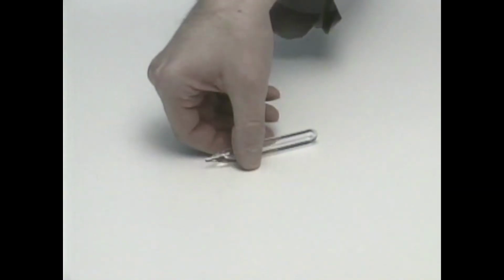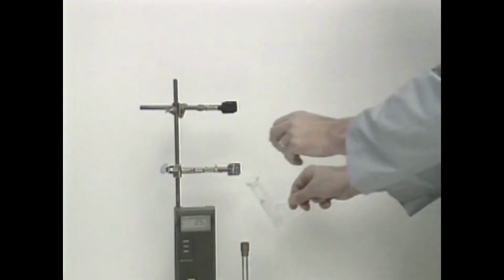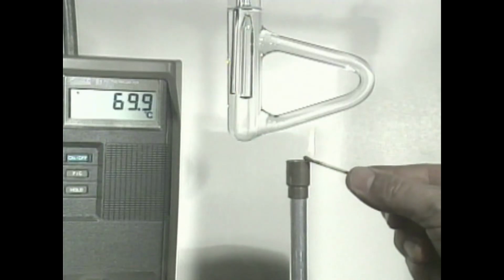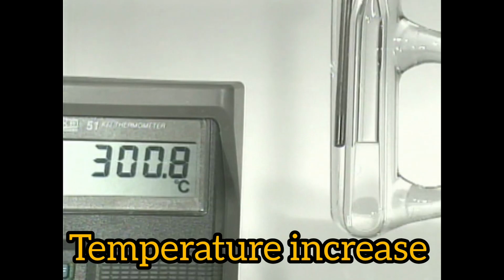A sealed vial containing only benzene liquid and vapor is placed in a Thiele tube, which is then filled with silicone fluid. Heat is applied with a Bunsen burner. As the temperature rises, the liquid meniscus flattens. This flattening is due to the increased energy of the benzene molecules. The forces due to increased molecular movement are beginning to overcome the attractive molecular forces at the surface.